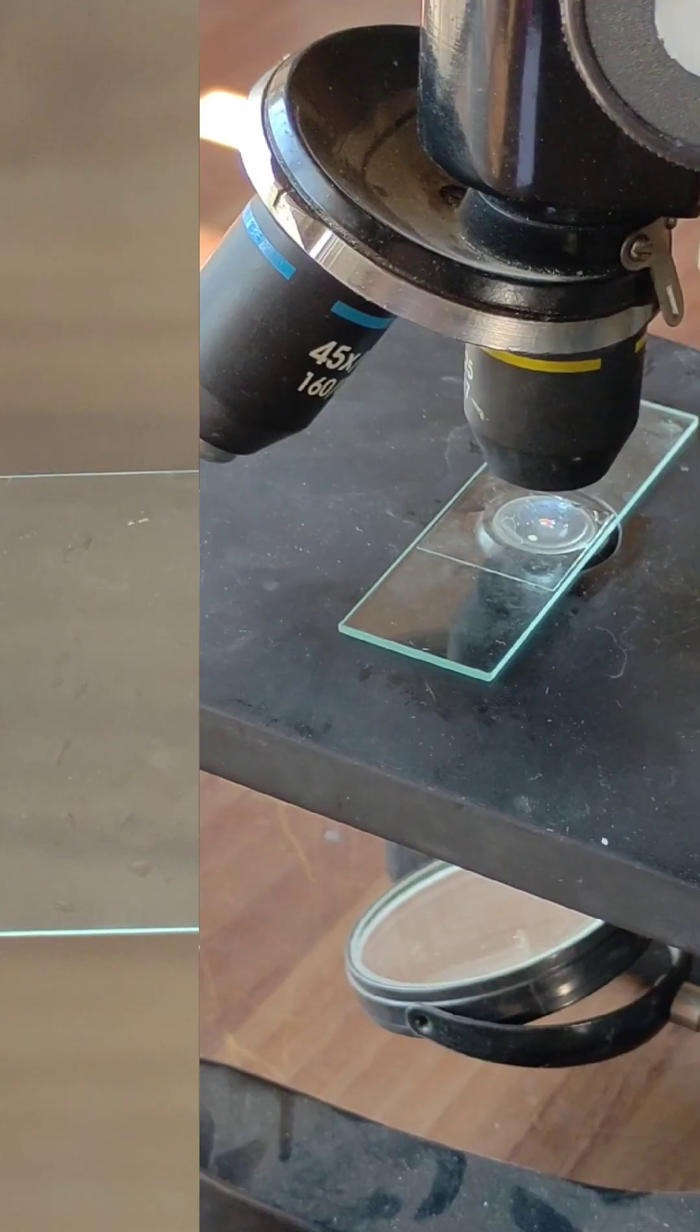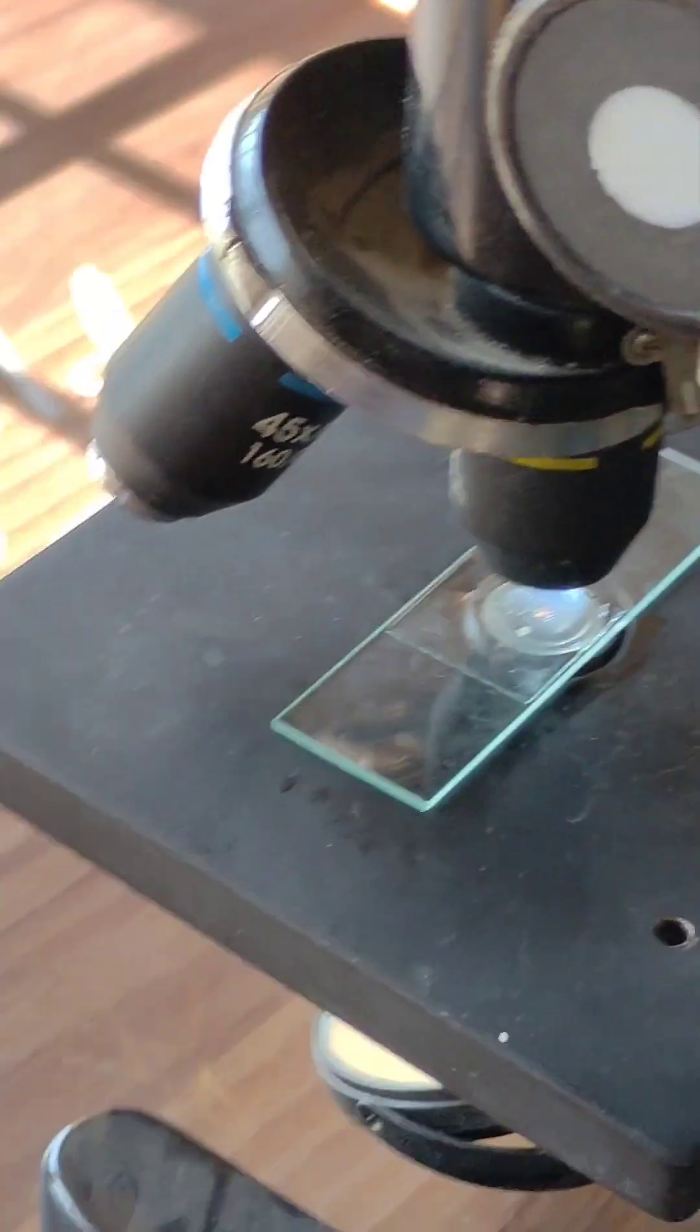Now, we will keep this slide in microscope. Now, we see it through the lens.